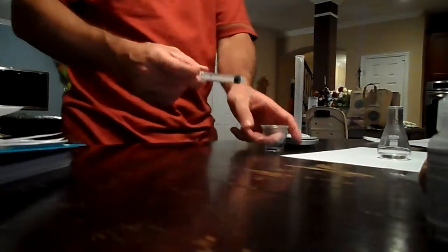Hopefully it's the last slide that we have to use. Okay, where is the syringe? Here it is. Okay, 0.5 of each. So it says transfer the 10 milliliters, fill the syringe, try to minimize the air, and then record the initial volume of the solution in the syringe to the nearest 0.1 into the data table. Volume of vinegar, density. Okay, I have 2.5 in the syringe.